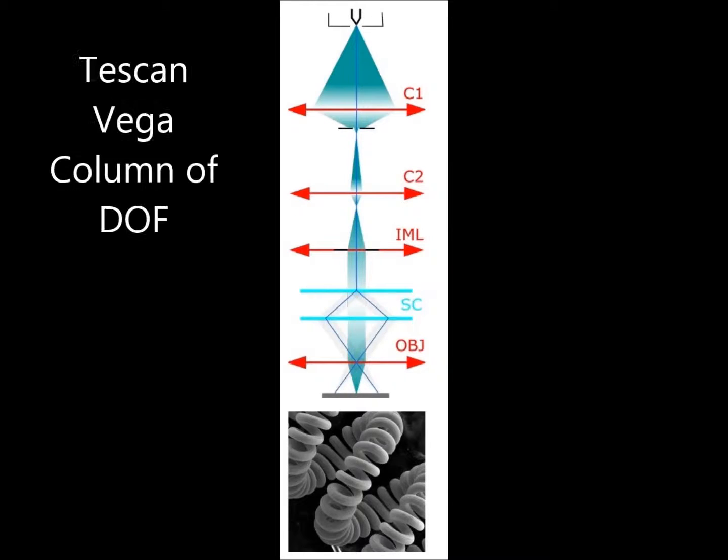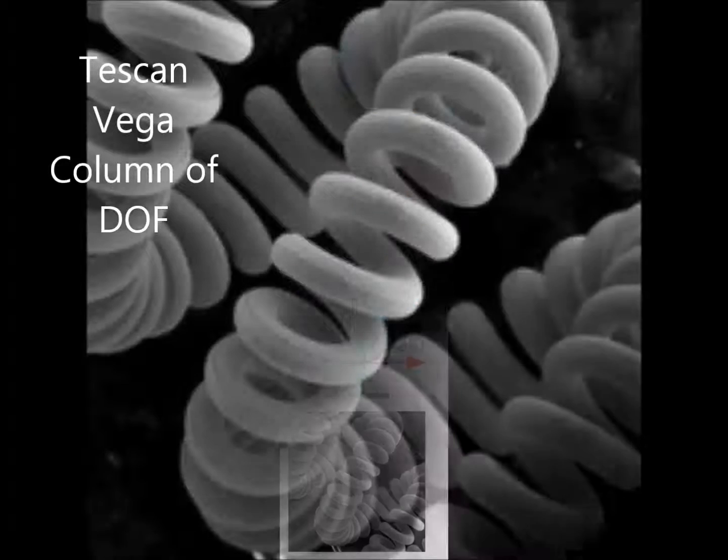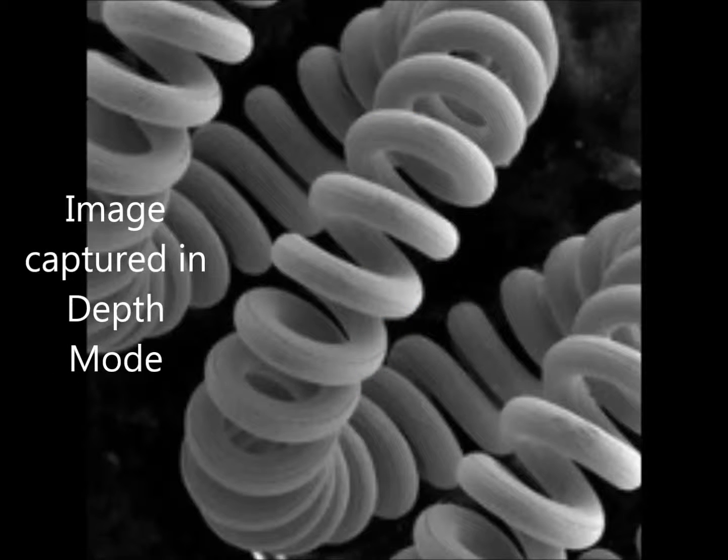Next on the list would be the depth mode. Depth mode differs from resolution mode by the usage of the intermediate lens. The aperture of the final beam is lower, but the spot size is bigger in comparison with the resolution mode. The beam and the probe stay unchanged. This is recommended for basic imaging at moderate currents with an increase of depth of focus. It's mainly good for good resolution, but with an increase of depth of focus.